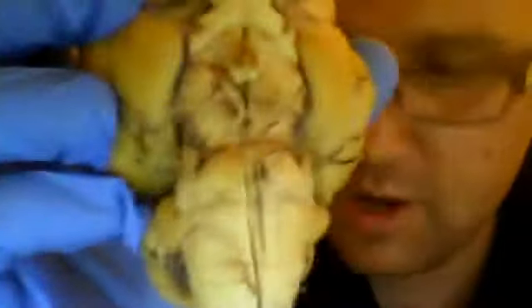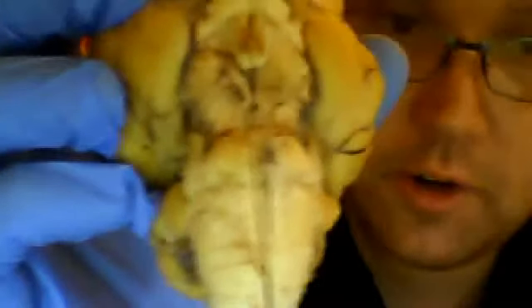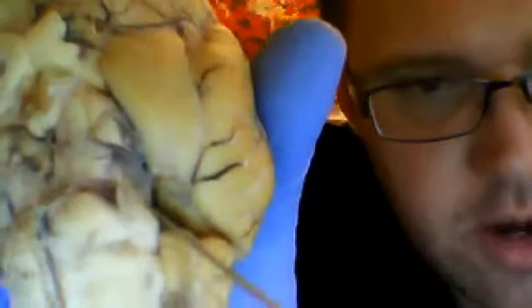Now, moving on from there, you have the trochlear nerve, and the trochlear nerve is located further down, closer to the cerebellum. I'm going to coax it a little bit and point it out to you. There we go. So the trochlear nerve, if you were to look at it, it's going to be right about there. It's a very thin, translucent structure at this point in time, but it's definitely there.